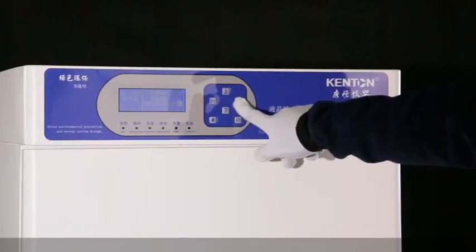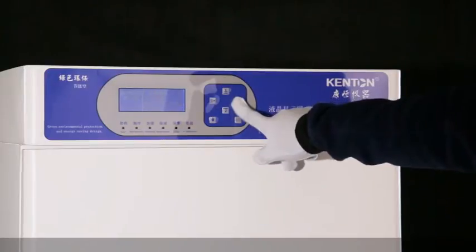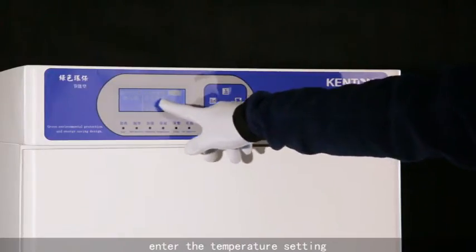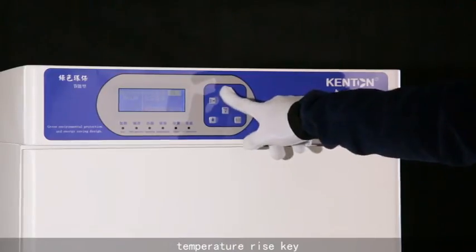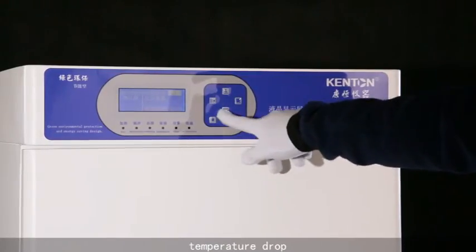Press the set button. Enter the temperature setting. Temperature rise key, temperature drop.